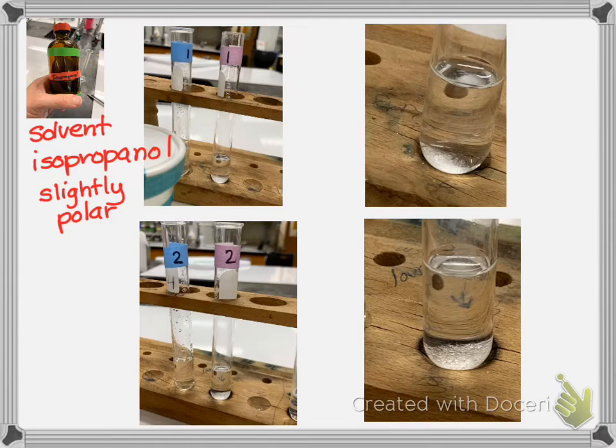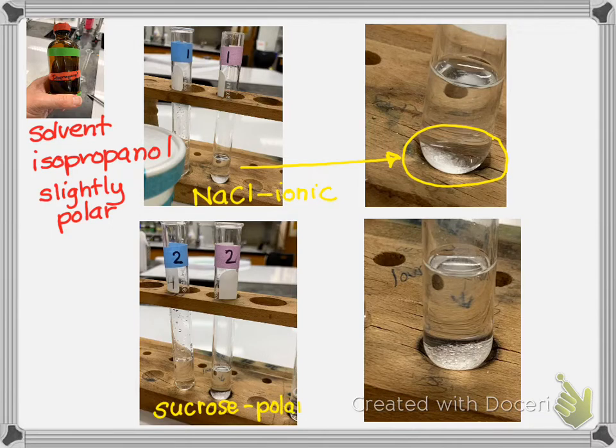So let's take a look at our substances. Number one is NaCl, which is ionic. And when I look, what do you see in the bottom? So you have to define, is that soluble or insoluble? Number two is sucrose, and sucrose is polar. And if I look over here, and I did let this sit and I mixed it with a stirring rod. Look what's here. Is that soluble or insoluble?